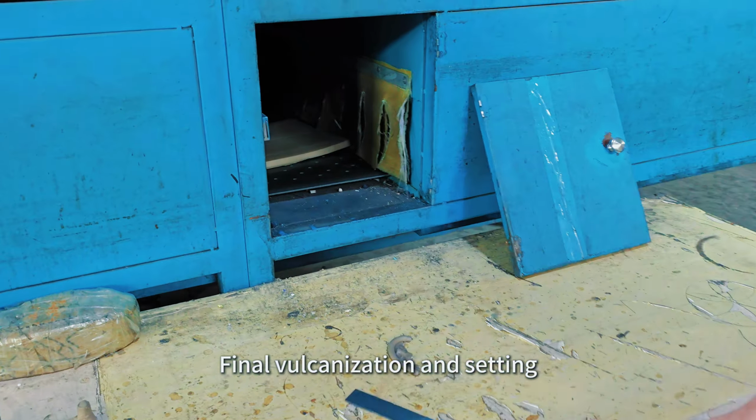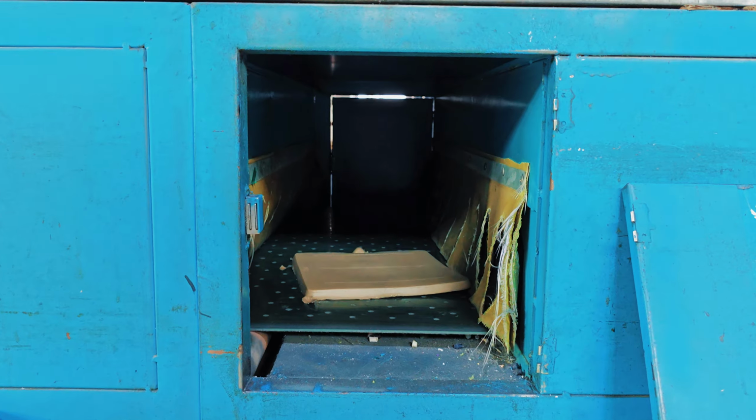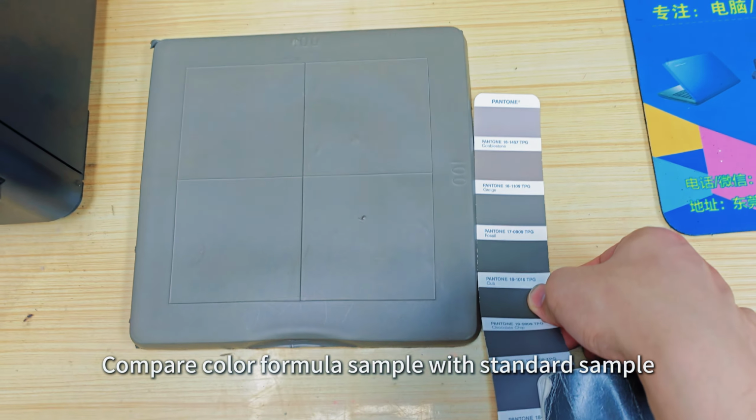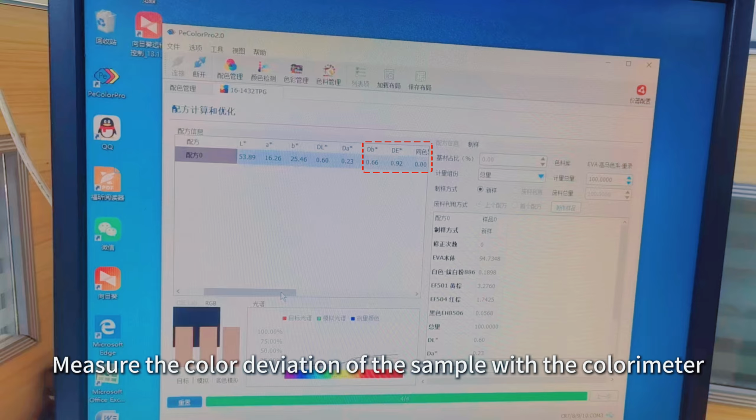Final vulcanization and settings. Compare color formula samples with standard samples. Measure the color deviation of the sample with the colorimeter.